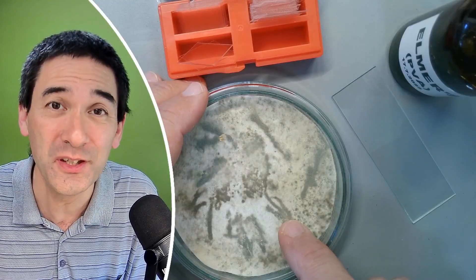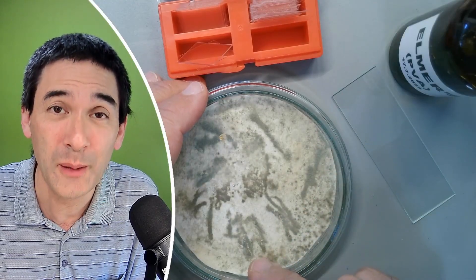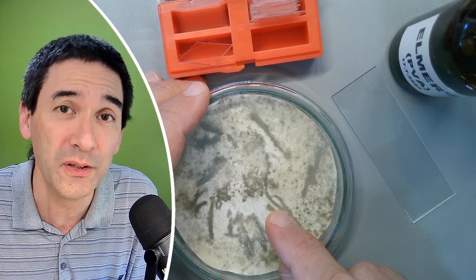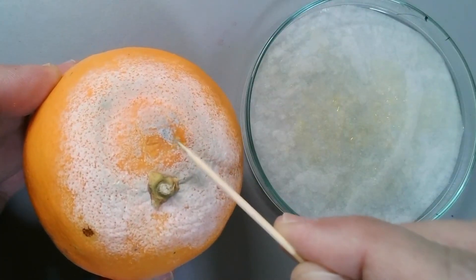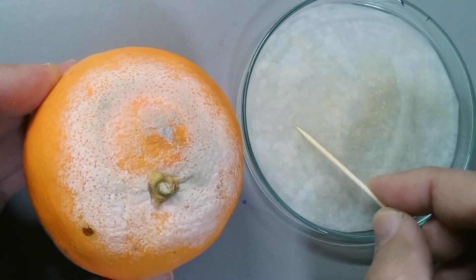The gray things that you see in here — these are the spores of a fungus. I've grown them inside this petri dish. It's probably not healthy to inhale them. Where did I get the fungus from? That's the fungus that was growing on a citrus fruit, like for example on lemons and oranges. It's actually one of those fungi that causes significant damage to those fruits.